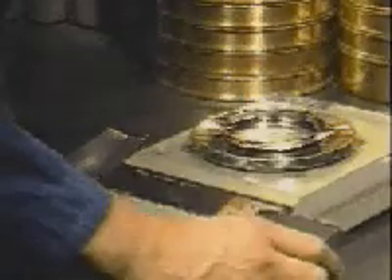Weigh the correct amount of powder to be used, as obtained in accordance with MPIF Standard 01 and based on the sample's apparent density as indicated in Table 1.